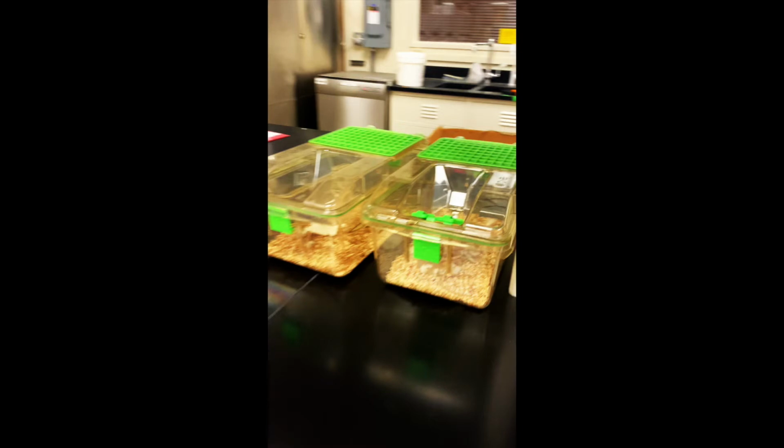Dr. Shin obtained his doctoral degree in neuroscience, and so he's interested in understanding how the brain controls metabolism and nutrient partitioning. One of his projects involves the association between type 2 diabetes and Alzheimer's disease, and this is kind of where my project falls under. My research involves studying the gene expression in the brown adipose tissues of mice with Alzheimer's disease. So it's really cool to see how different principal investigators with their own unique disciplines can come together and ask similar questions, but through different lenses.